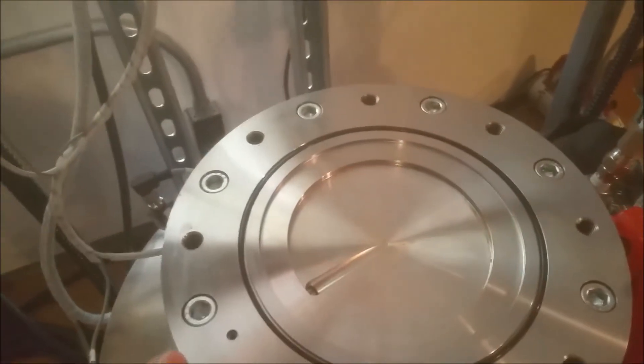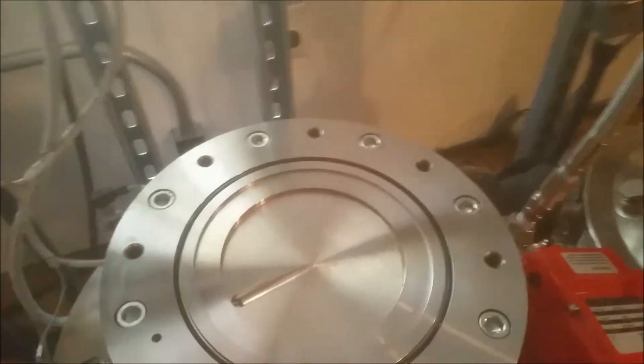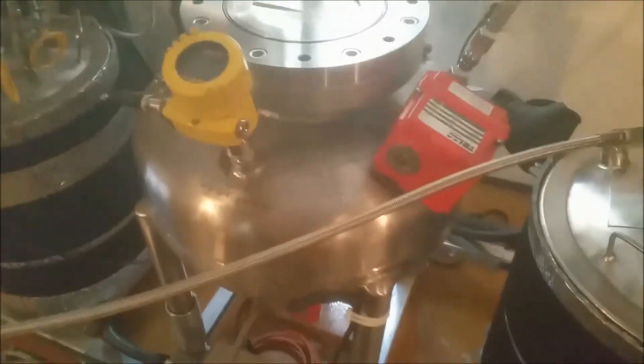If I open the wafer valve you can hear pressure inside of the tank, but when I close it I can remove the column and this large volume of vapor pressure is held intact.